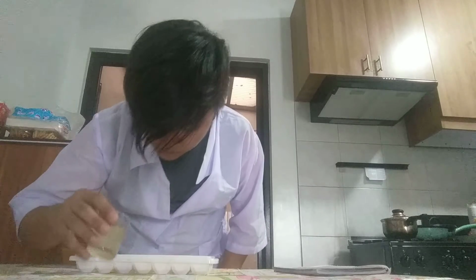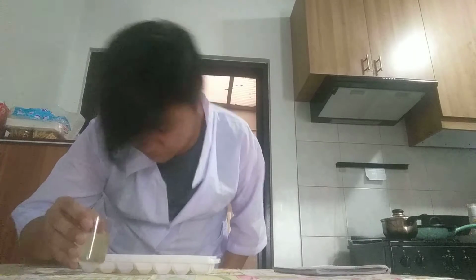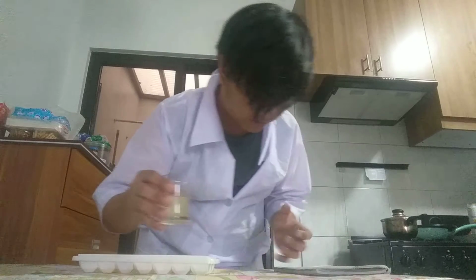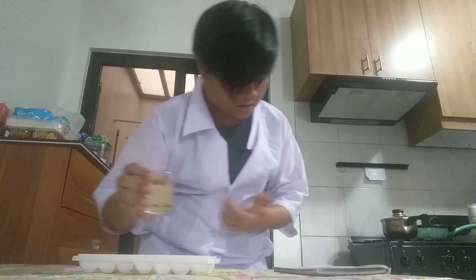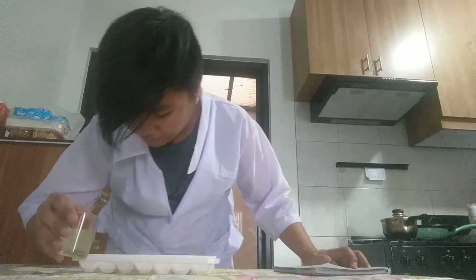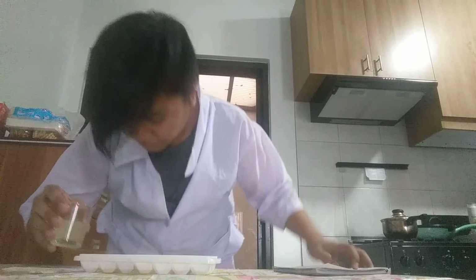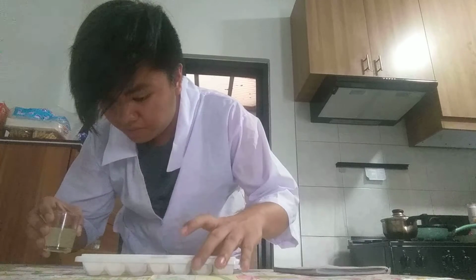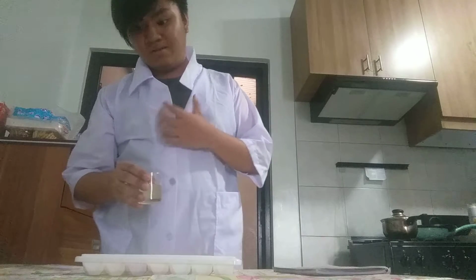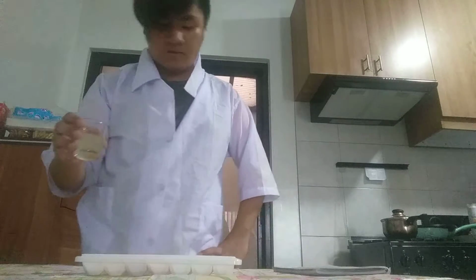Okay, so next is the soda. We add here soda. It's the same. It's like adding water into Coke or something like that. Like the color of Coke is a bit brighter now. Next, vinegar. Okay, let's do this. Okay, so the color of the vinegar starts to become a bit more watery, because again I added water mixed with carrot juice.